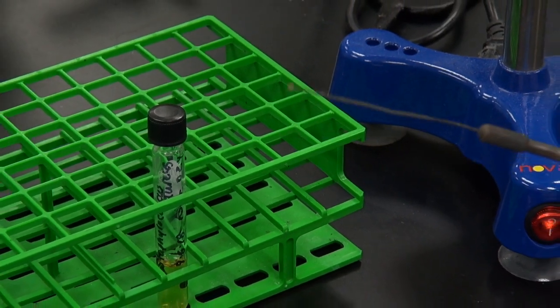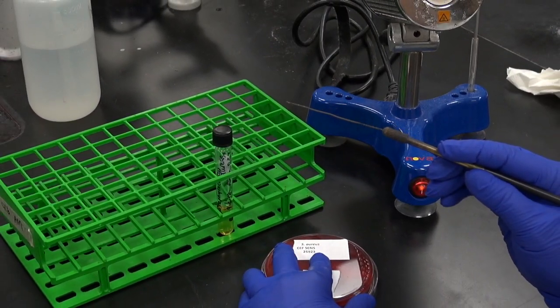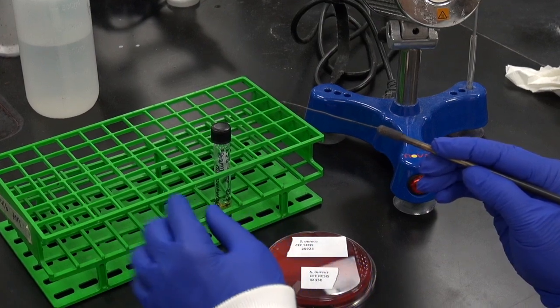Close the original culture plate, then pick up the broth tube.